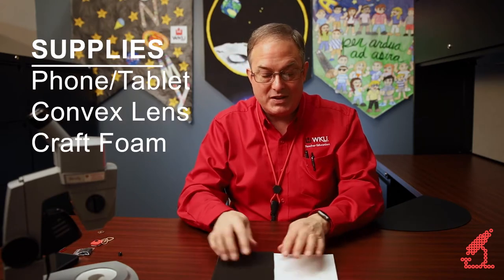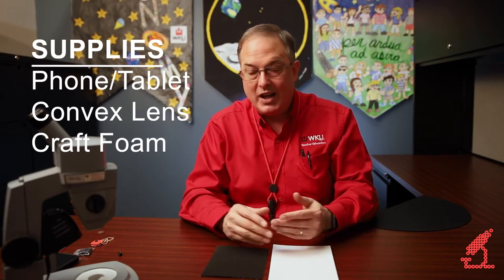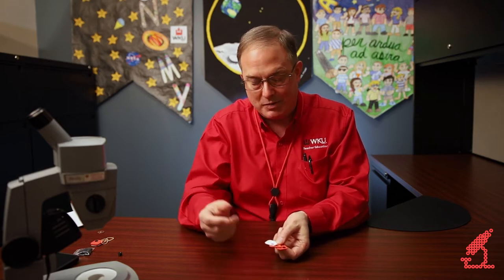Besides that, you're going to need some foam rubber — exactly the kind of foam rubber that you would pick up in a craft store or a department store. Color really doesn't matter; you can make these in your school colors. I like to make one piece white, and you'll see in a moment why. What you're going to do is cut three pieces of this foam rubber. This is a one-inch square with some rounded corners on it, and you can cut this yourself.